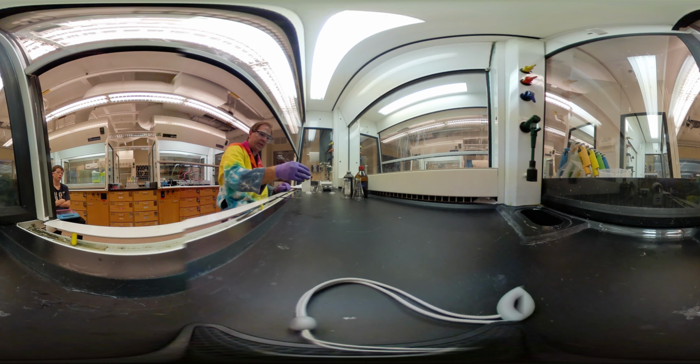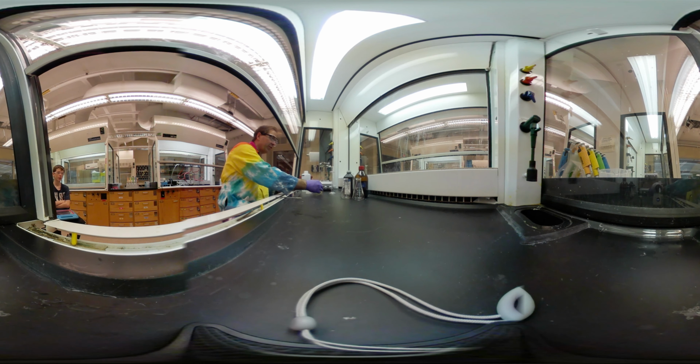I actually got a good yield there, so we should be able to get a good reaction here in a minute. Now, this is more concentrated than we want for the reactivity, so we're actually going to dilute some of it in just a minute. But I'm going to give it some more time to dissolve while I prepare solution B here. Go ahead and clean this off.